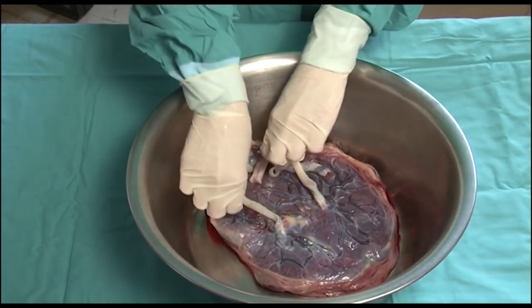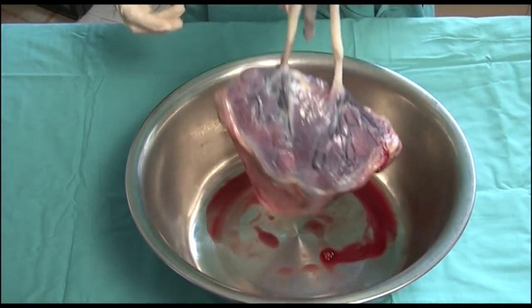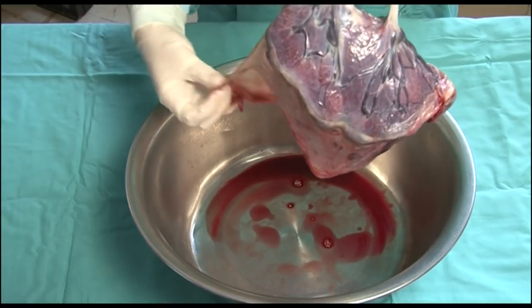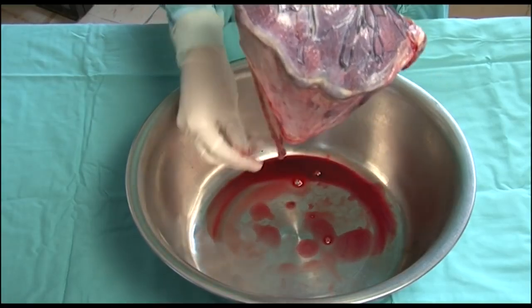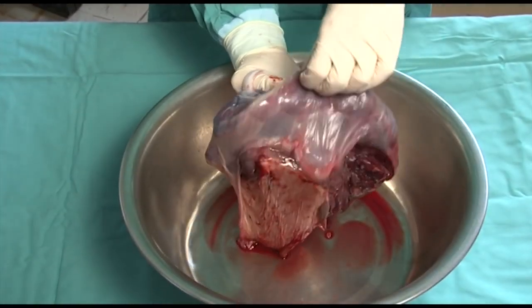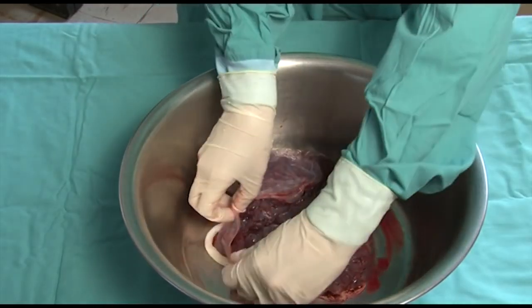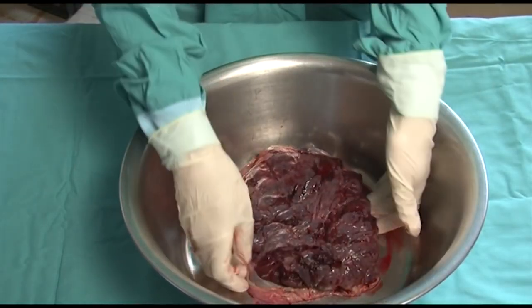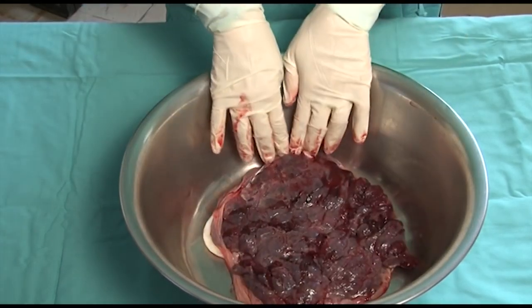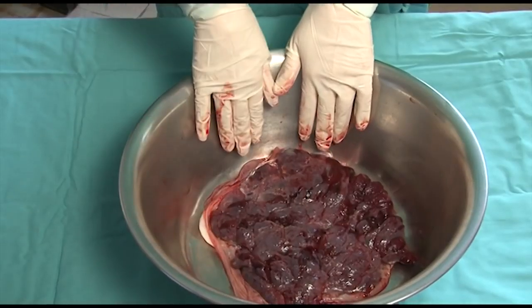The umbilical cords are lifted, and it is once more demonstrated that the inverted membranes only formed one amniotic sac. There is no membrane which could have separated the twins from each other. On the maternal side, there is only one placenta with a single disc. Inspection shows a complete set of cotyledons and a normal surface. This then concludes the demonstration of various placental findings.